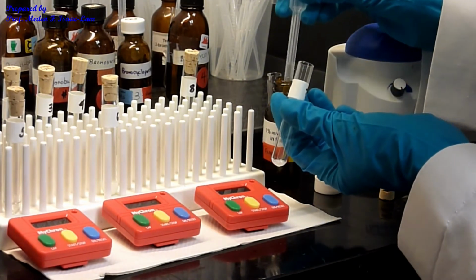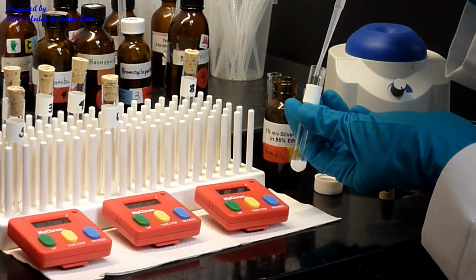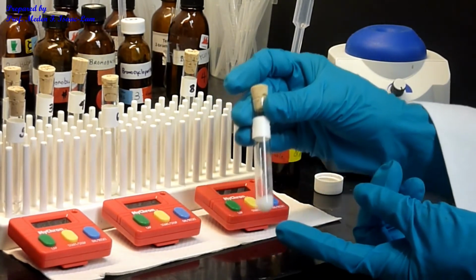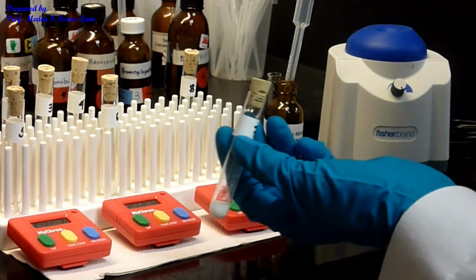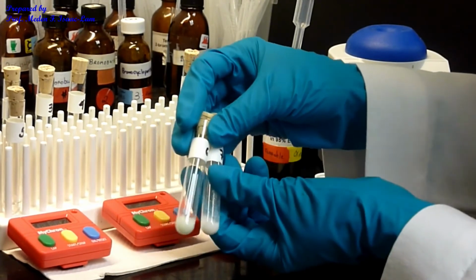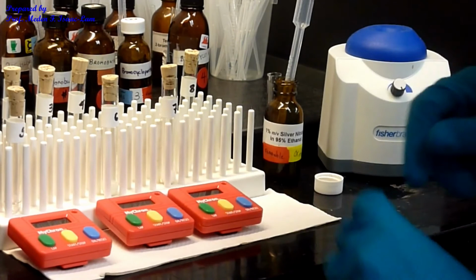So I'm gonna put now 19 drops. Alright, so a lot, actually. So in like 26 seconds, I see a lot. Okay? So there's a lot here actually on the side. So 7 is faster than 6. Okay? And then we're gonna do 8 next.